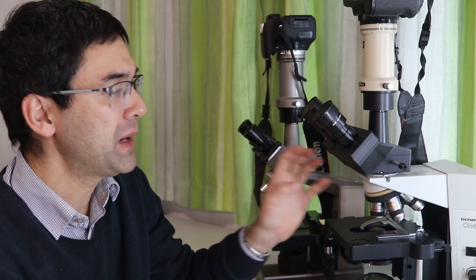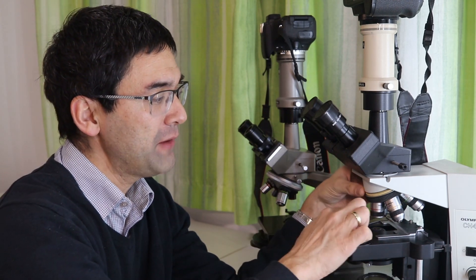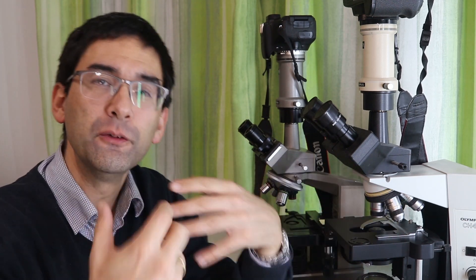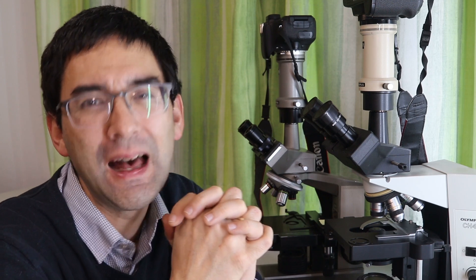I'm going to use this here as an example. My microscope here, if I basically now have an image in focus using the 4x objective, then it's also more or less going to be in focus with all of the other objectives. But if one of them is now from a different company or even if it fits in well, if it's from a different company or even a different series, it's going to be off focus when you start using it. And that means you have to turn the focus quite a bit. You don't know into which direction to turn it. You might end up crashing the objective into the slide. So it is actually a little bit of a hassle. So I do not necessarily recommend this.